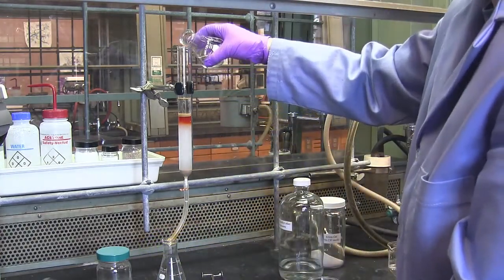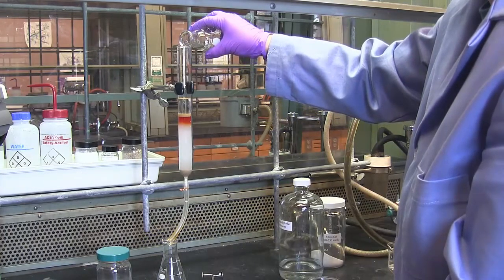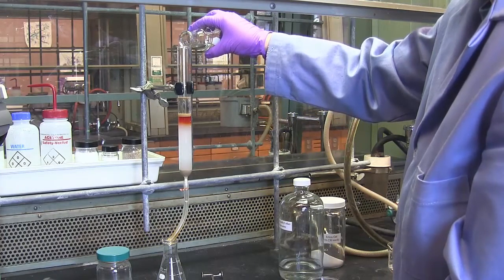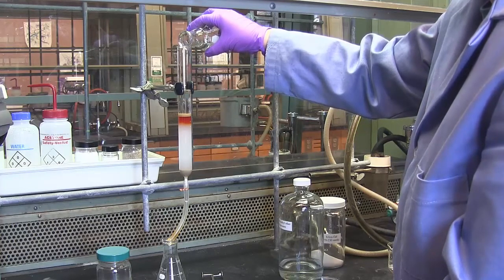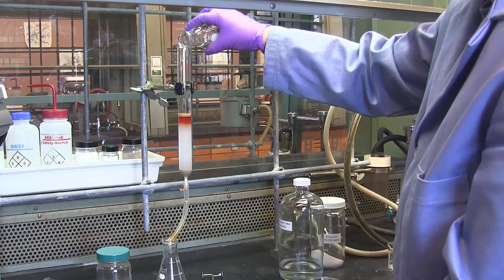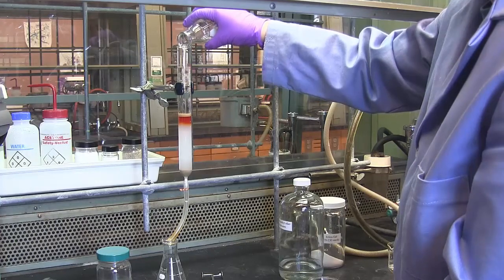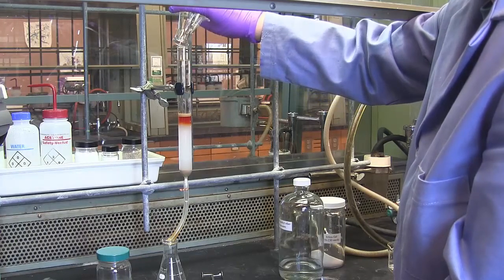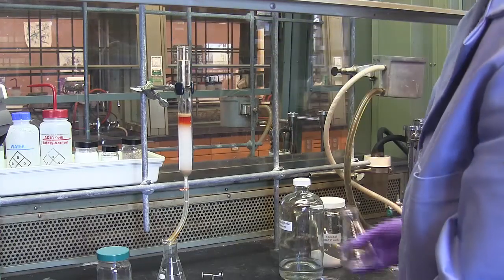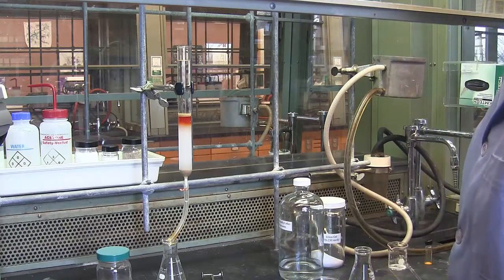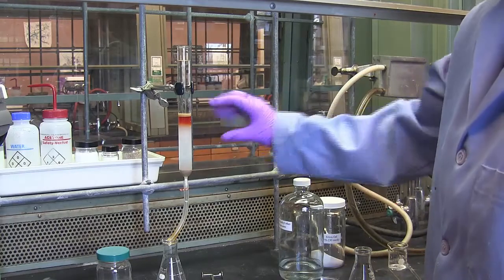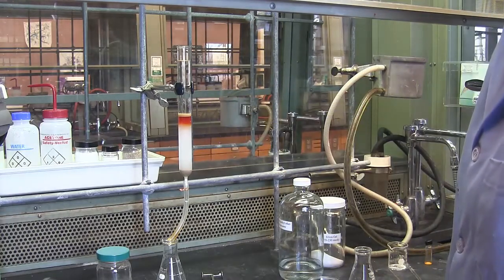So now I have a little bit of a solvent buffer on top of the column. I'm going to very carefully, very slowly pour solvent to fill the rest of the glass column. This will increase your drip rate out of the bottom of the column as the weight of the solvent now will begin pushing through the column more quickly.